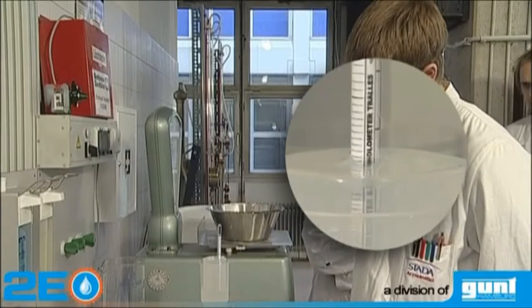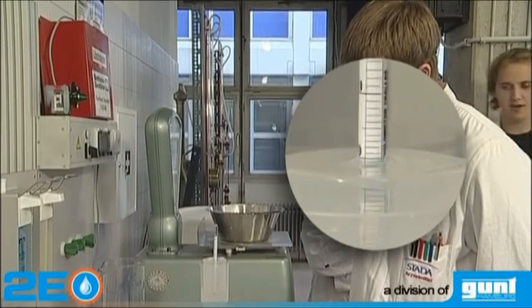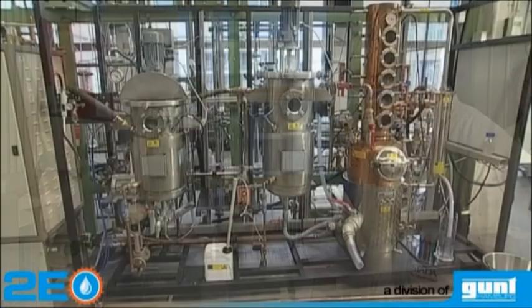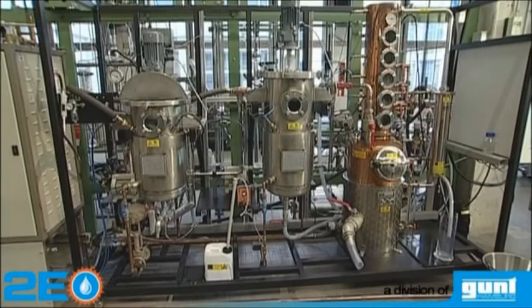The CE640 biotechnical production of ethanol is an excellent teaching system that is also ideal for advanced biofuel research.